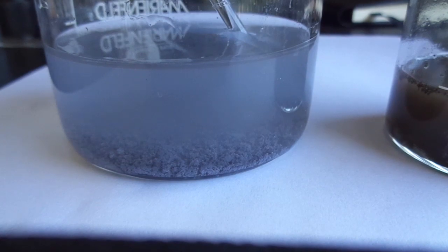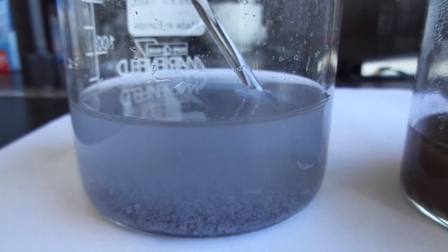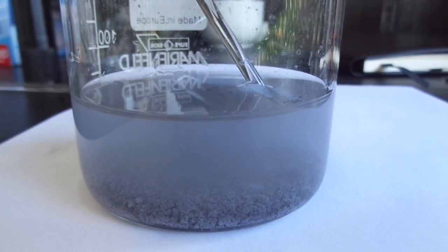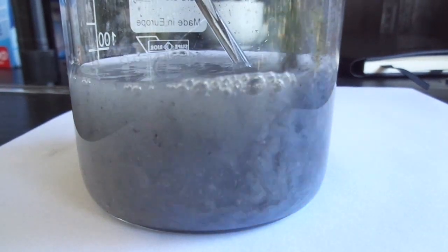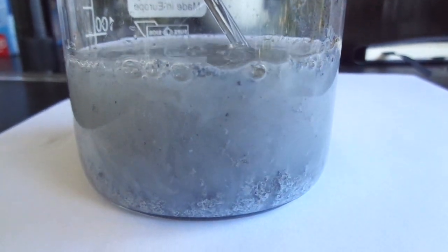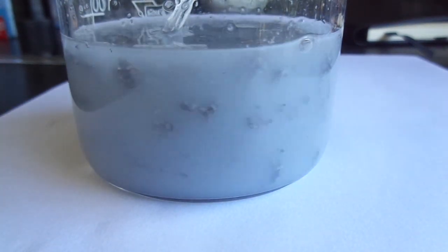I'm going to do that. There's supposed to be white fluffy stuff. Oh yeah, there was some white fluffy stuff. I'm going to use a little bit more acid.